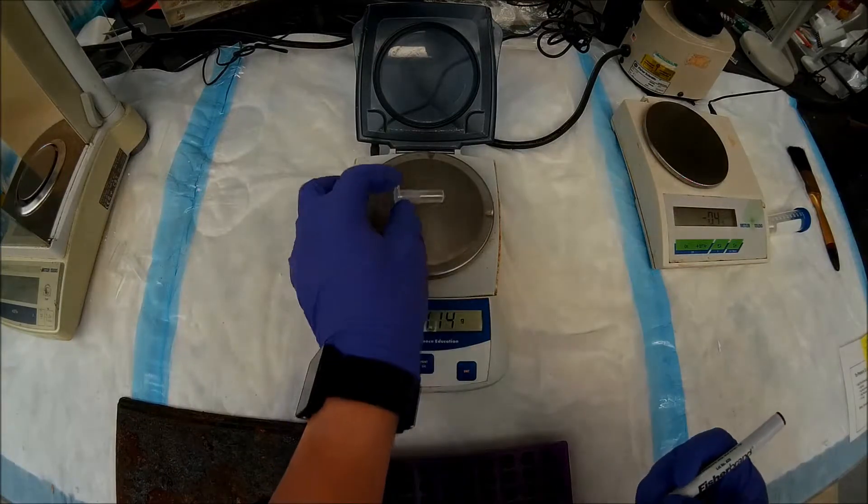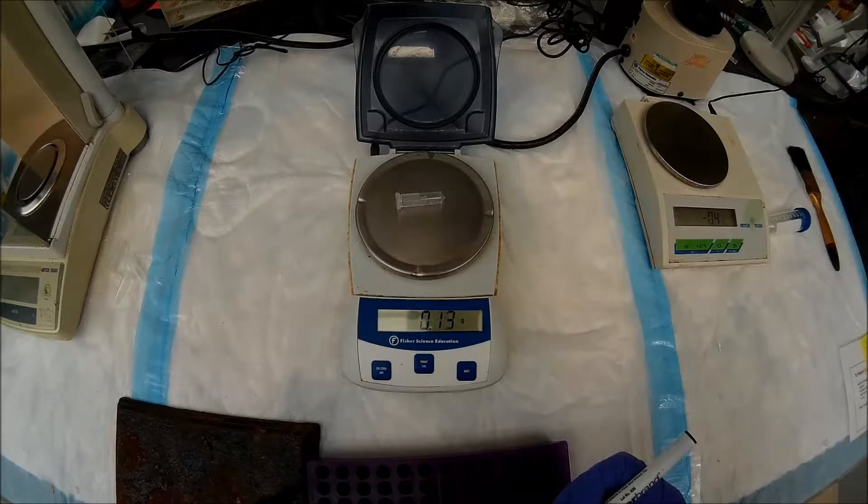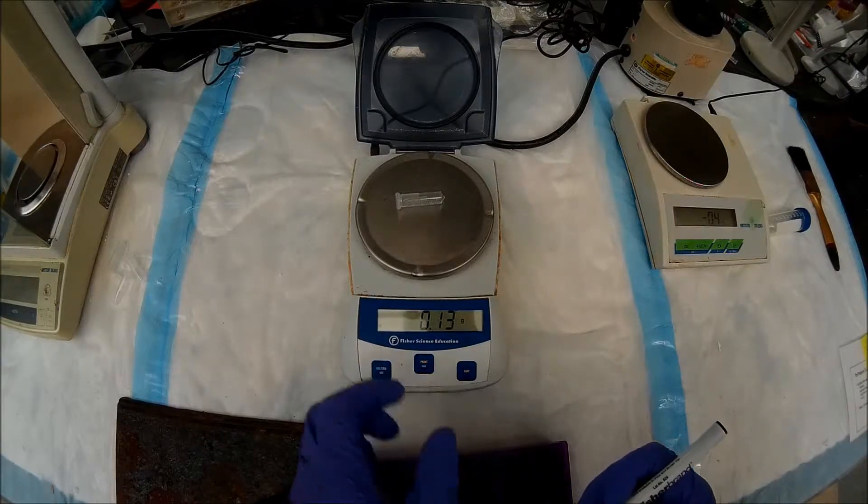And now the next one. And this one's 0.13 grams.